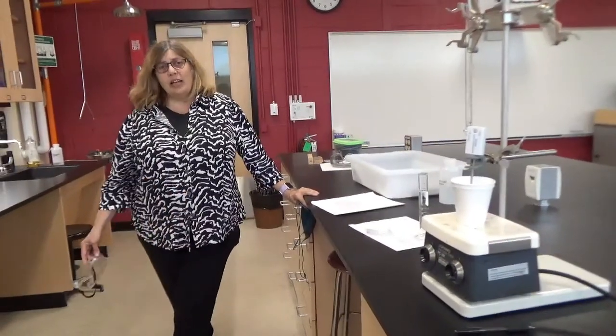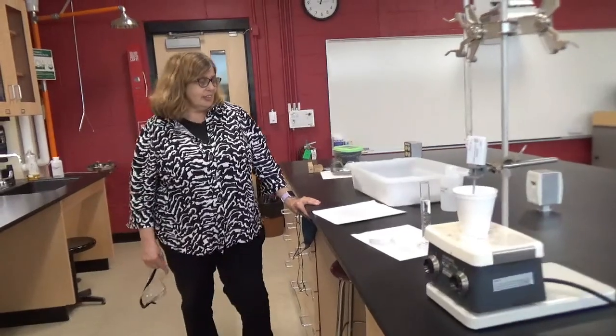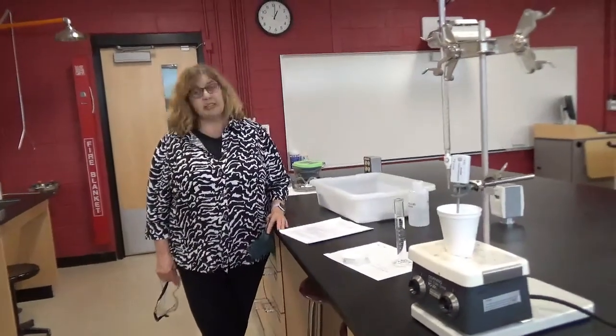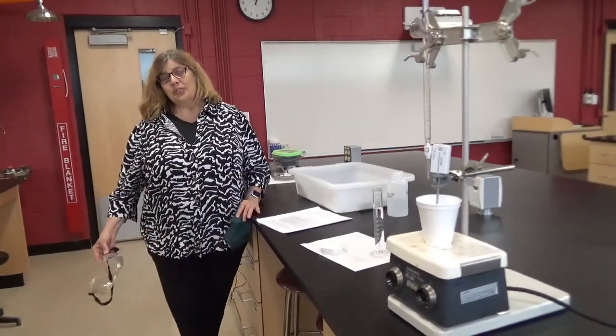Hi, today we're going to be doing a lab. It's the last lab of the semester. It's on thermodynamics, which we've been doing in class. And this is called the thermodynamics of the dissolution of urea. And as you should know, dissolution means dissolving.